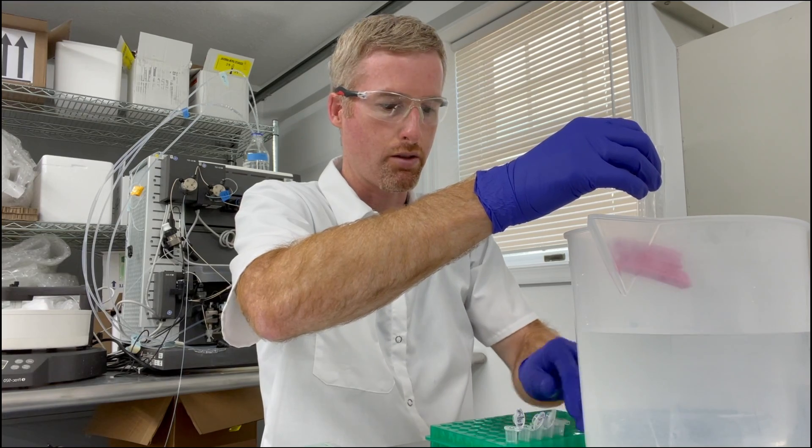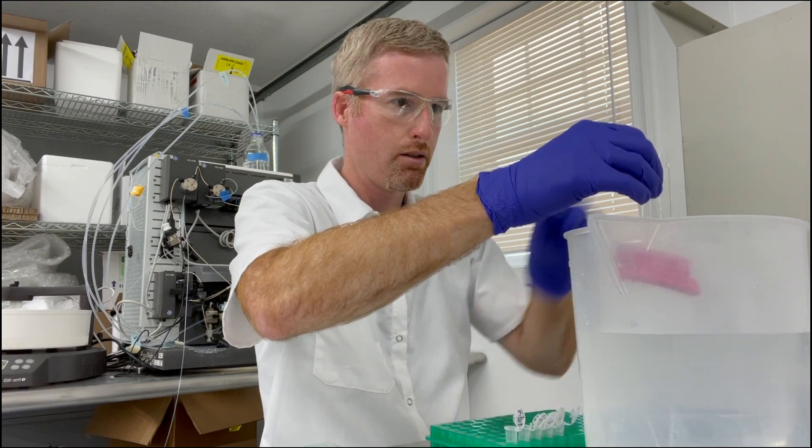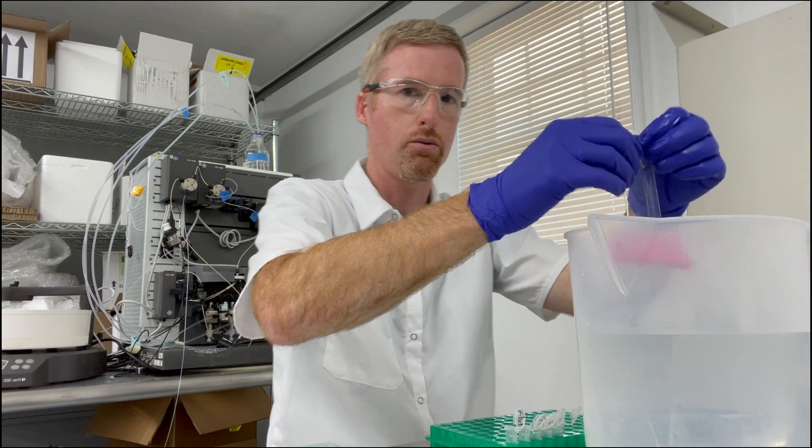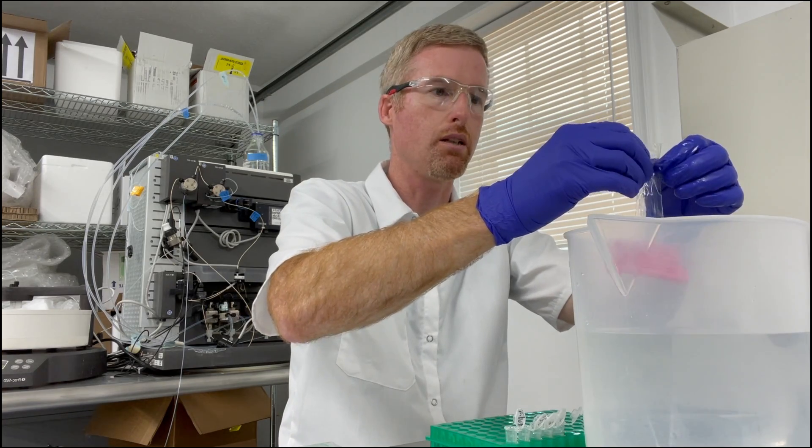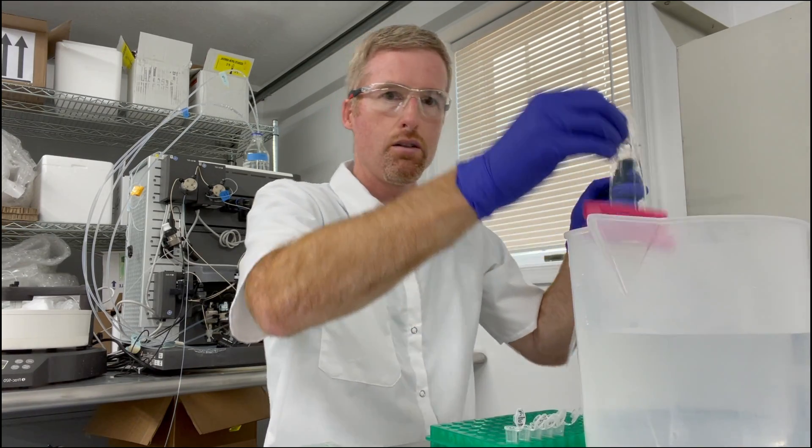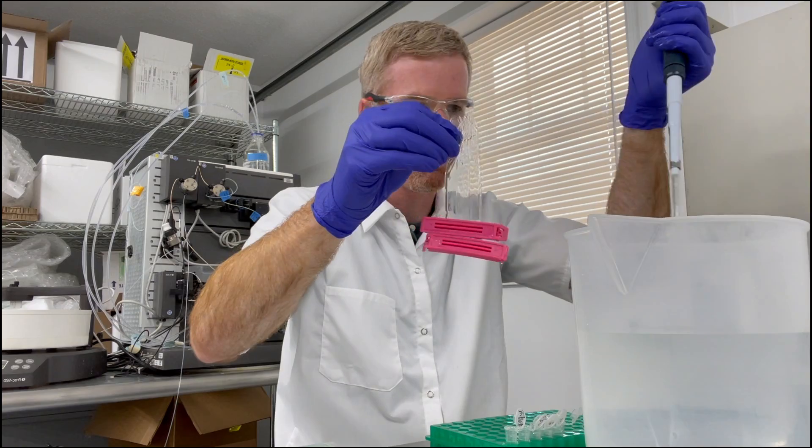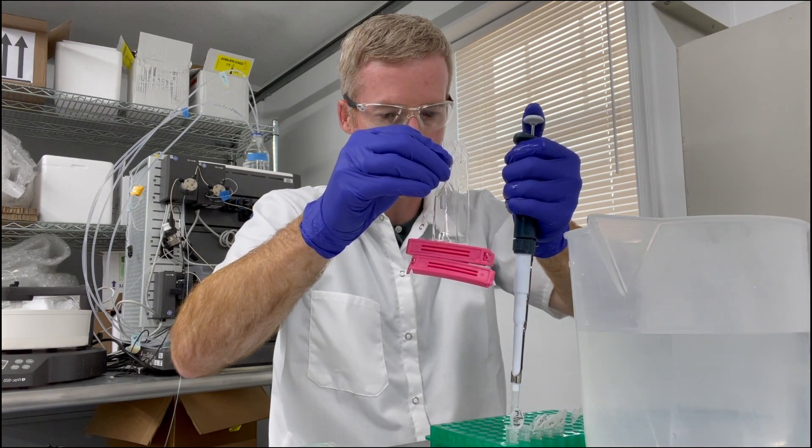So I'm going to open up my protein fractions, worry the top of the bag a little bit again, hold it on the side and put the protein in.